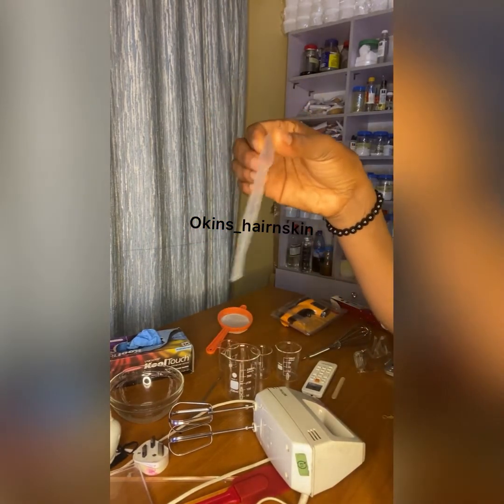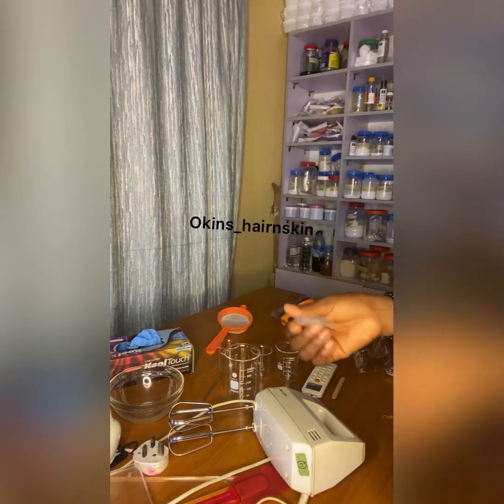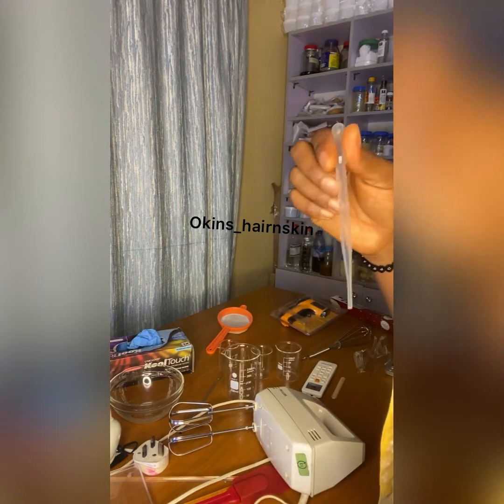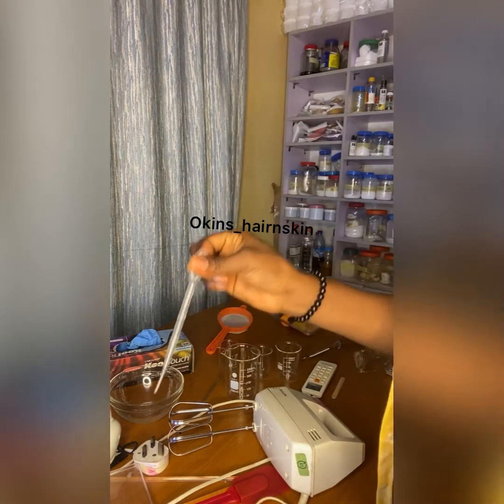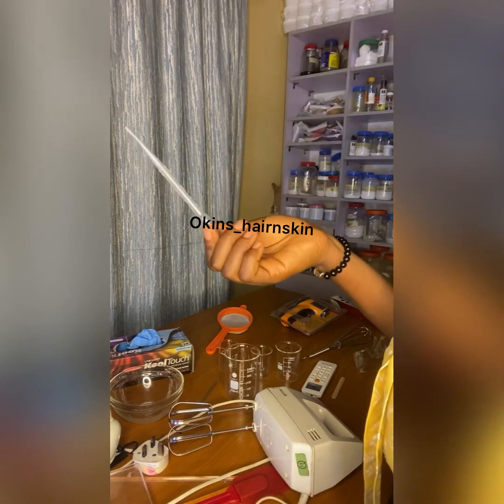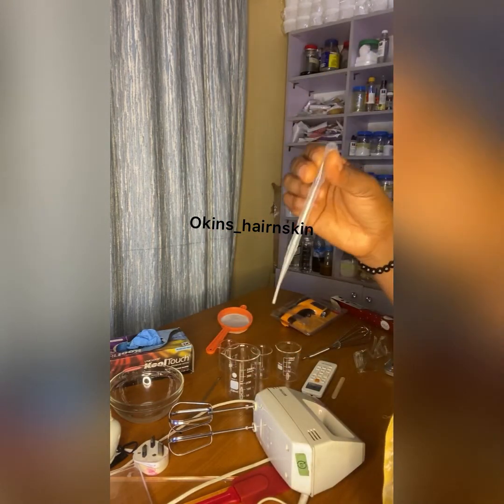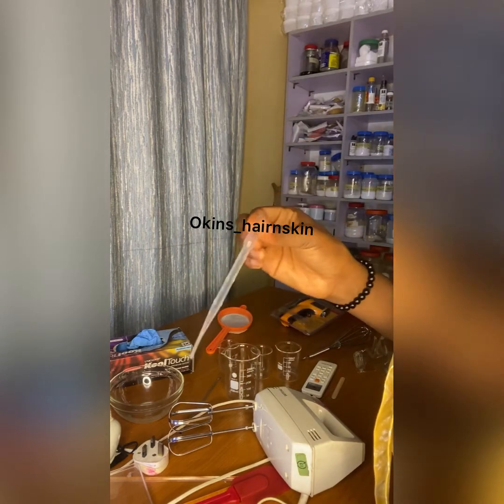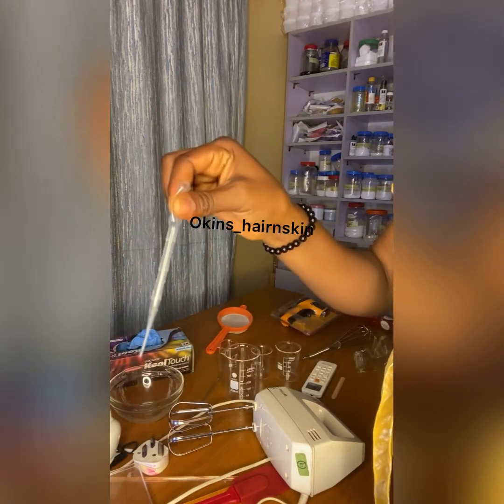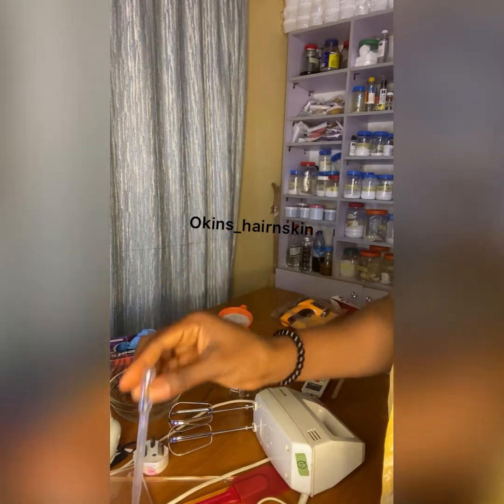this is a disposable pipette. You also need it as a young formulator. Even when you are advanced, you still need a pipette, because you actually use it to take liquid. But mind you, it's not advisable to use it twice, because you can't wash it properly. So when you finish using it, you use it for just one time. You use it to draw oil or liquid, or whatever liquid solution you are taking.